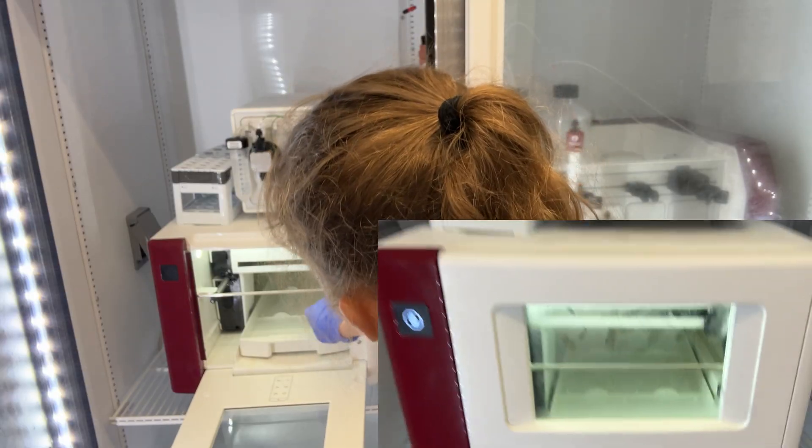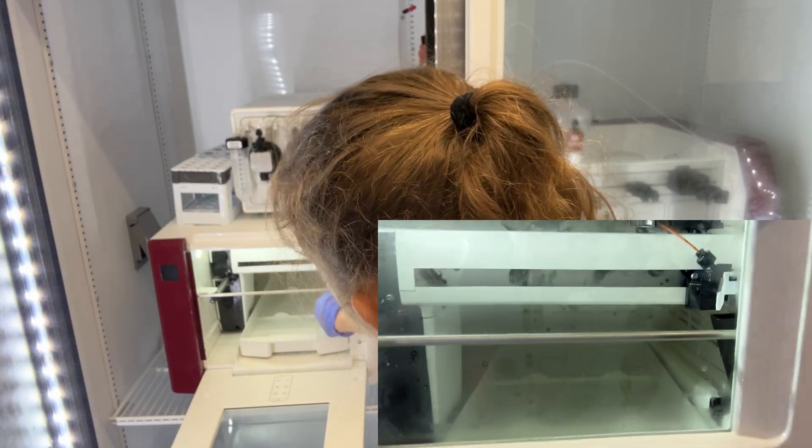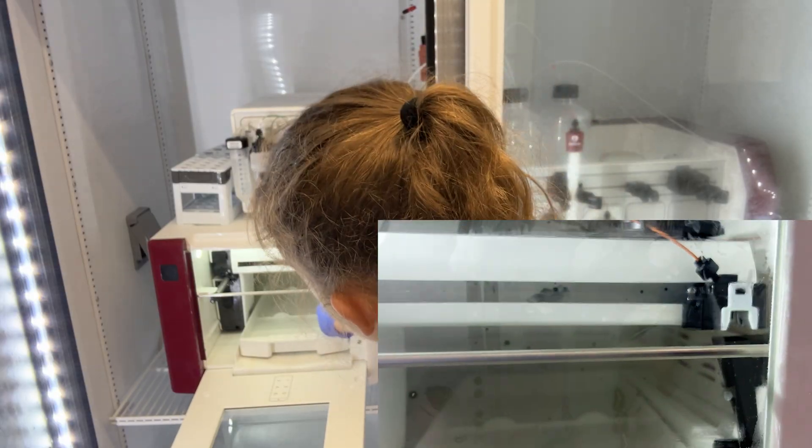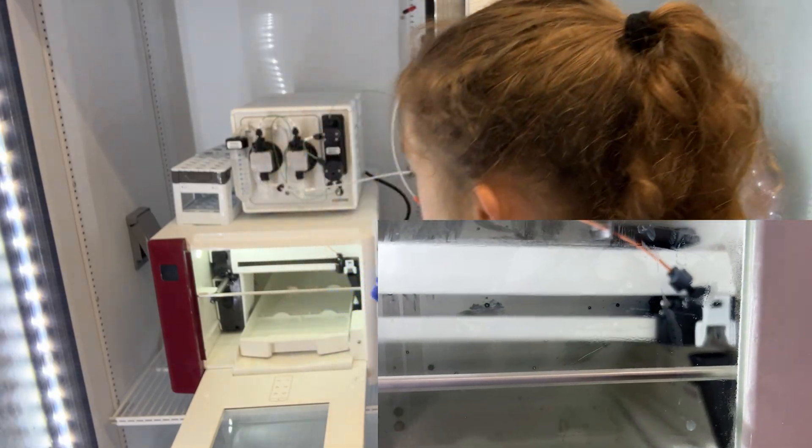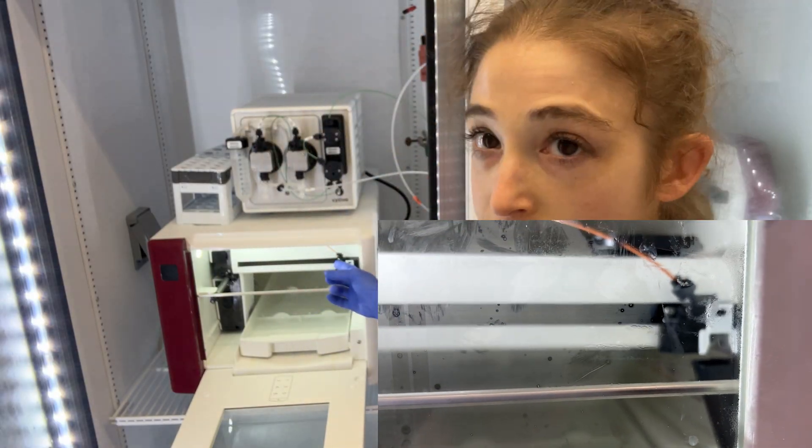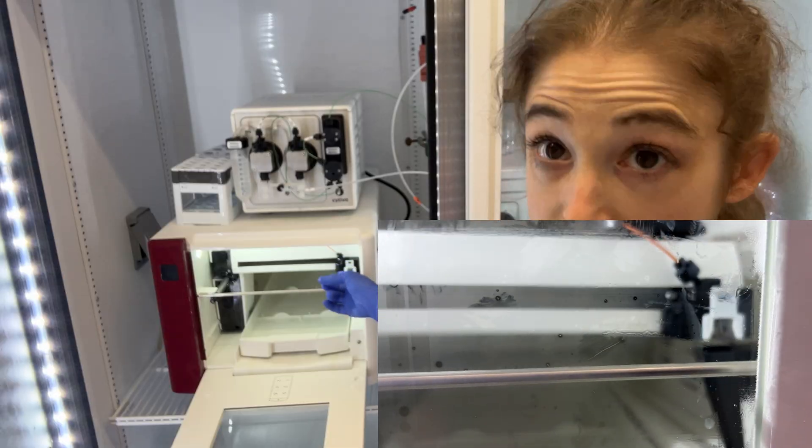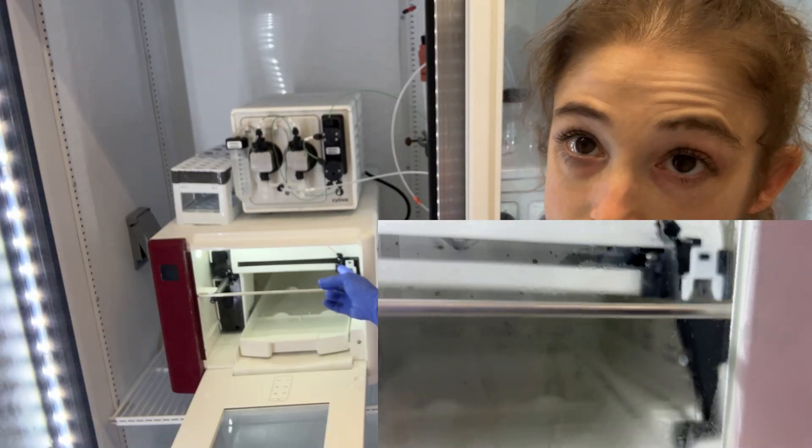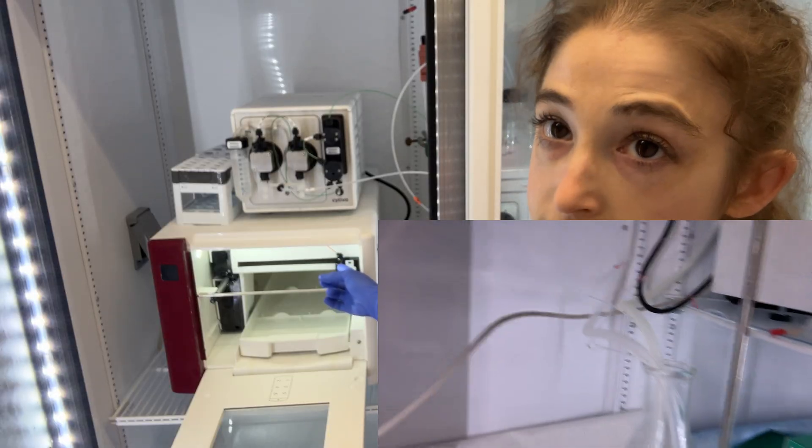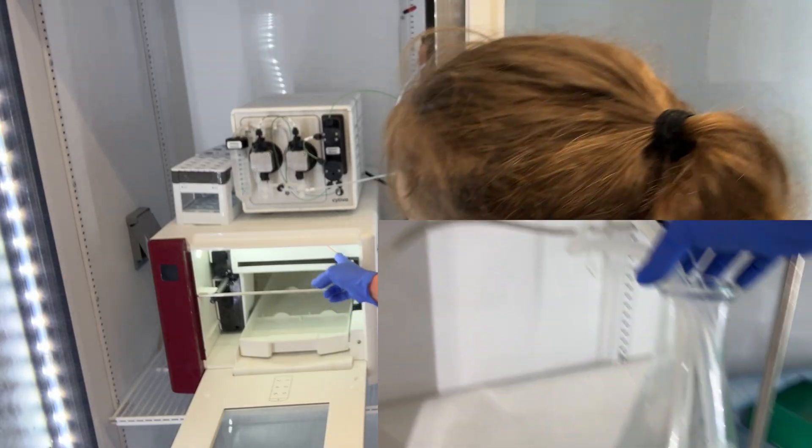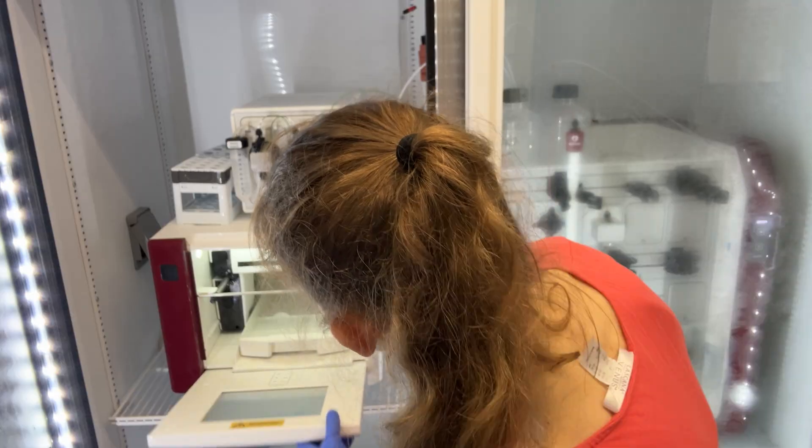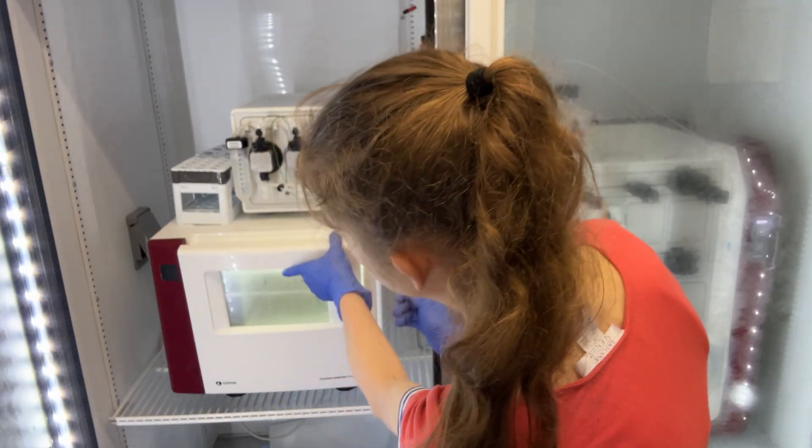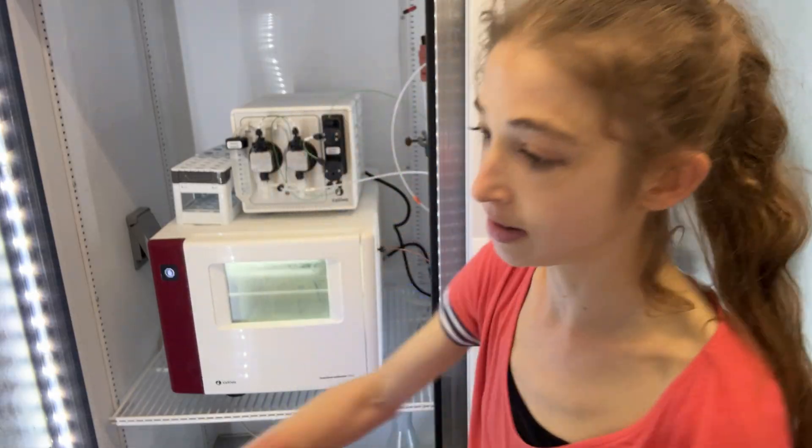So in the fraction collector, there's this head here that goes down to here, this waste, and so we can send the liquid traveling through those here, so it'll send water traveling through here after our run in order to then flush that line, wash that line.